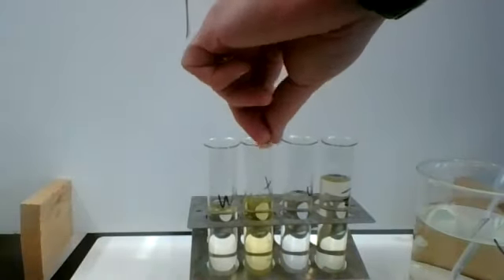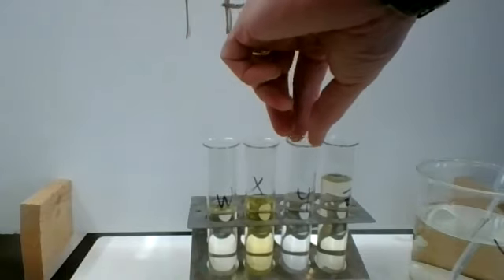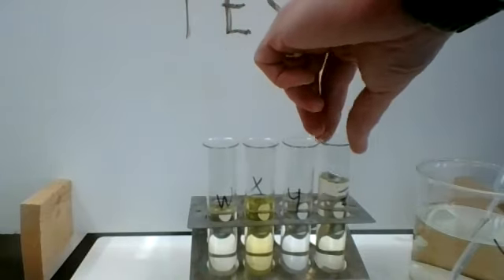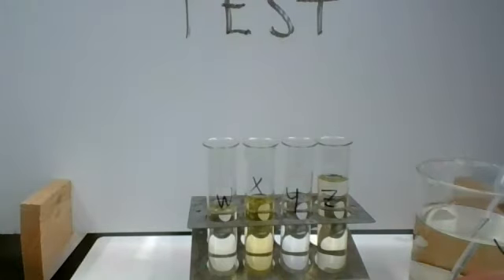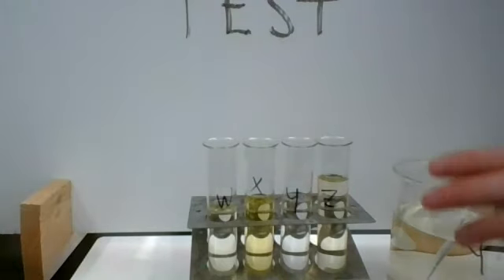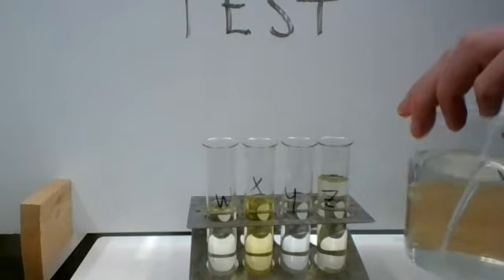X, Y, and Z, urine Z. Remember this one over here? That's urine Y. There's a lot of it. Look at the color.